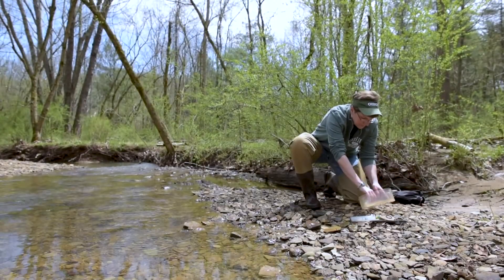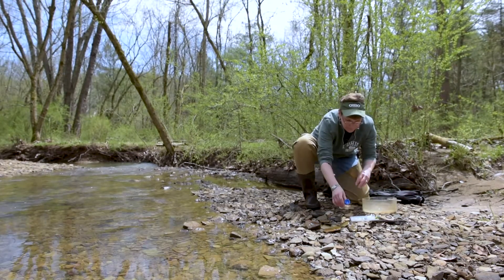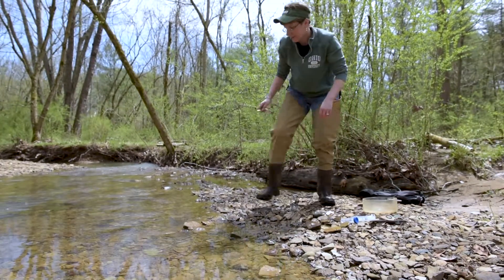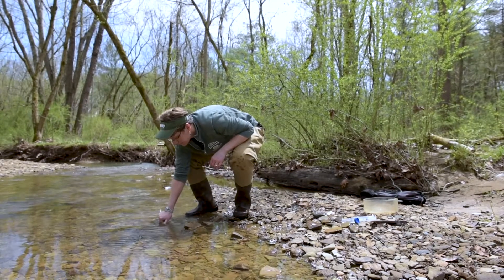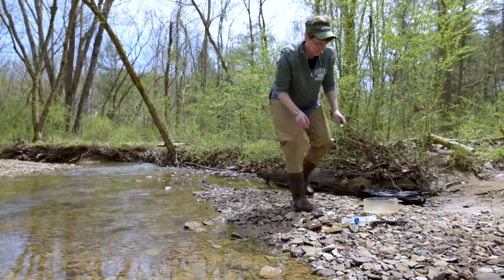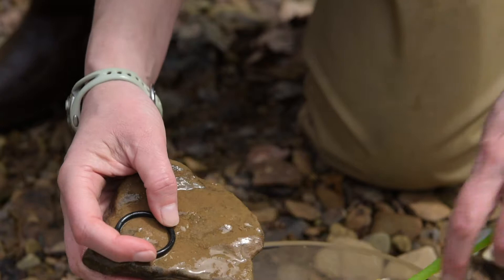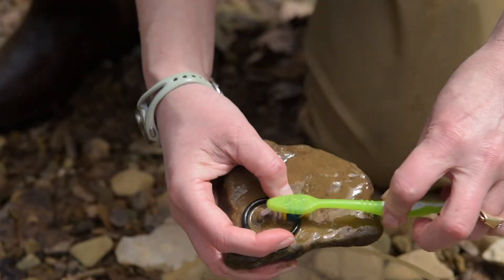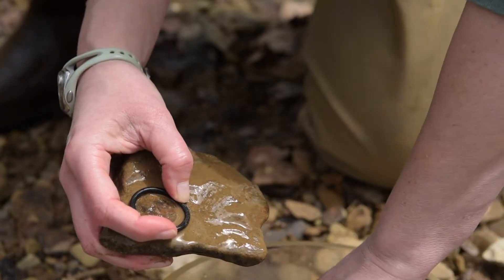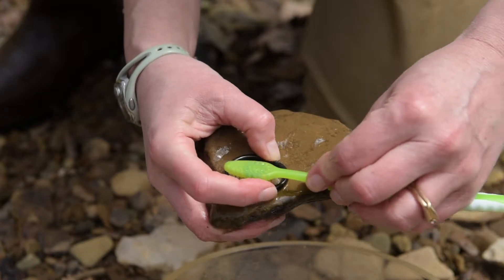First, we will get stream water to scrub our rocks. I have a 50 milliliter tube here. If using this size tube, you want to get 30 milliliters of water to use for scrubbing. The important thing is that you will be able to get all of the water in your container when you are done scrubbing. We are using an o-ring to mark the area of the rock that we will be scrubbing. Hold the o-ring securely on the top side of the rock and scrub with a brush. We need to know the area scrubbed later when we calculate the amount of chlorophyll A per area.